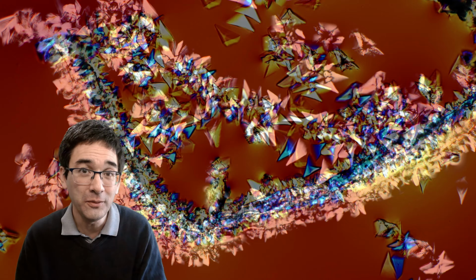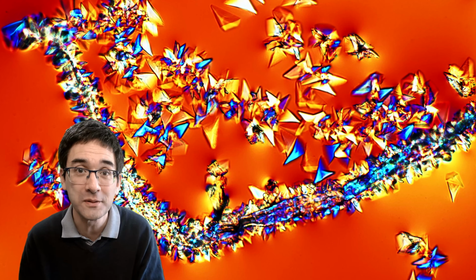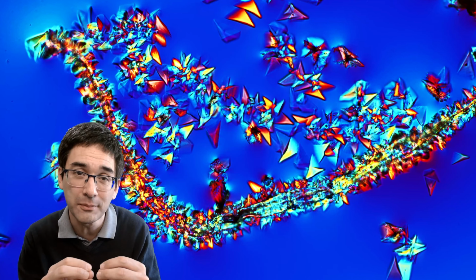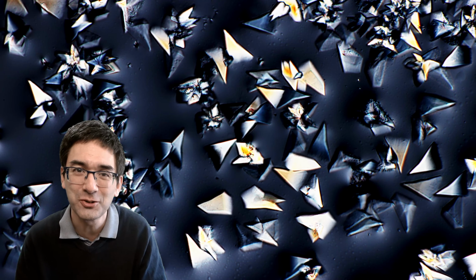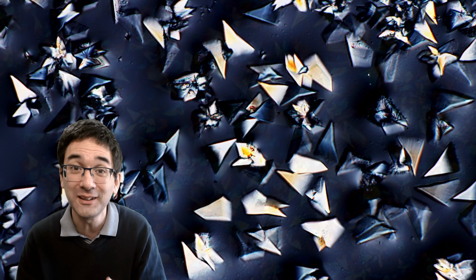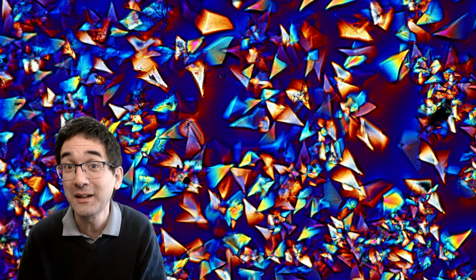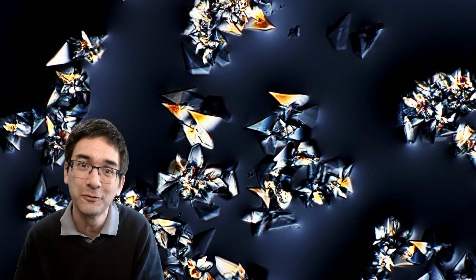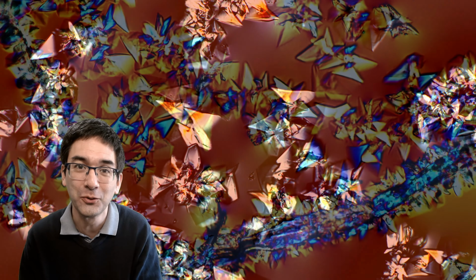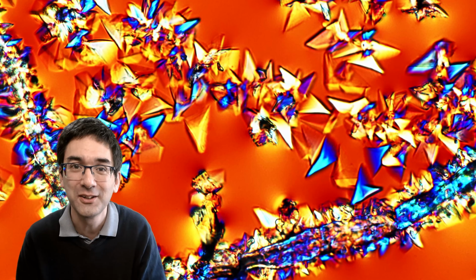This one over here now, this is a dust fiber, a little contaminant that was on my microscope slide, and you can see that the dust fiber itself is not visible anymore because there are small crystals growing on the dust fiber itself. And this actually shows that even the dust and the dirt can act like crystallization seeds. And in just a minute, I'm going to show you what happens when you add again a little bit of liquid to those crystals, because then the crystals are going to start to dissolve and disappear again.